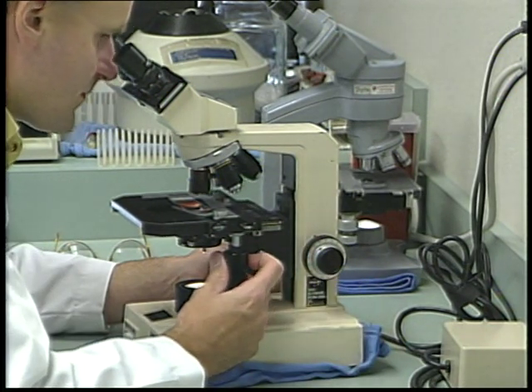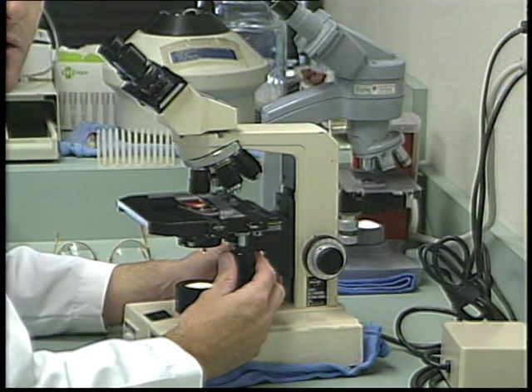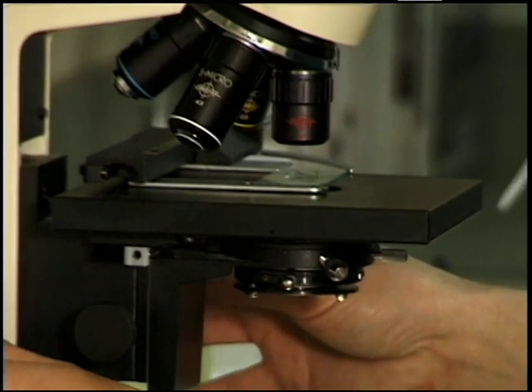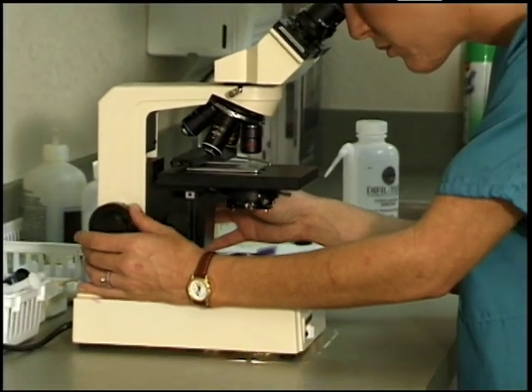When any of the contents being examined become visible, you can switch to adjusting the minor focus knob until the image is clearly in focus. As the slide is repositioned on the stage, you will most likely need to make adjustments to this minor focus in order to keep the image crisp. With one hand, you will likely need to readjust the focus, while with the other hand, you will need to control and move the slide.